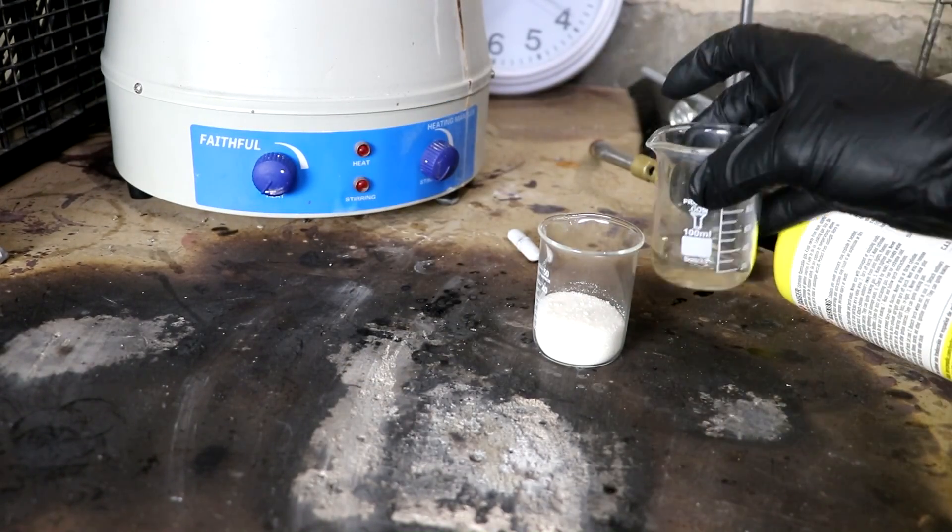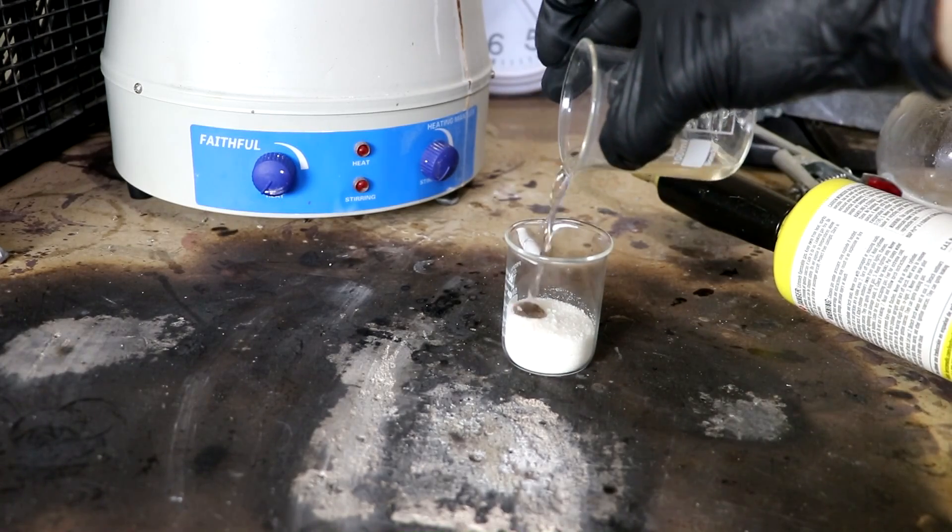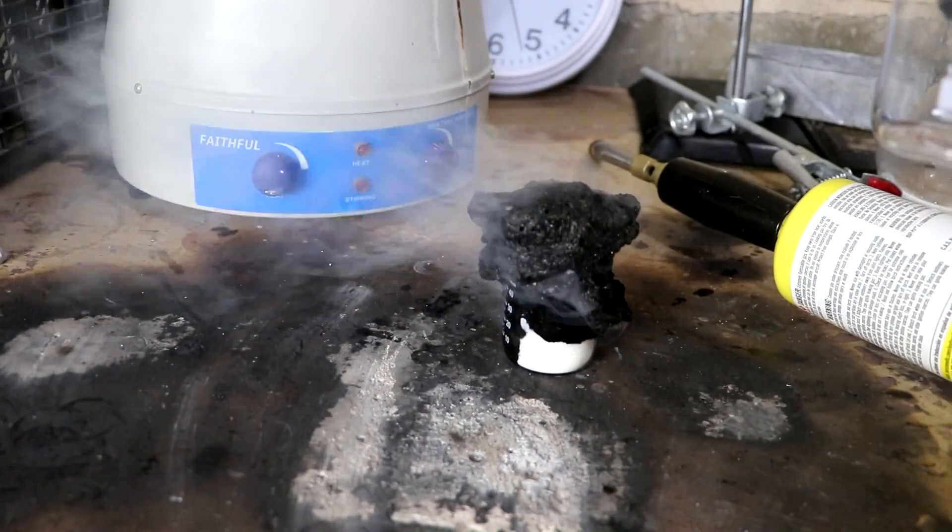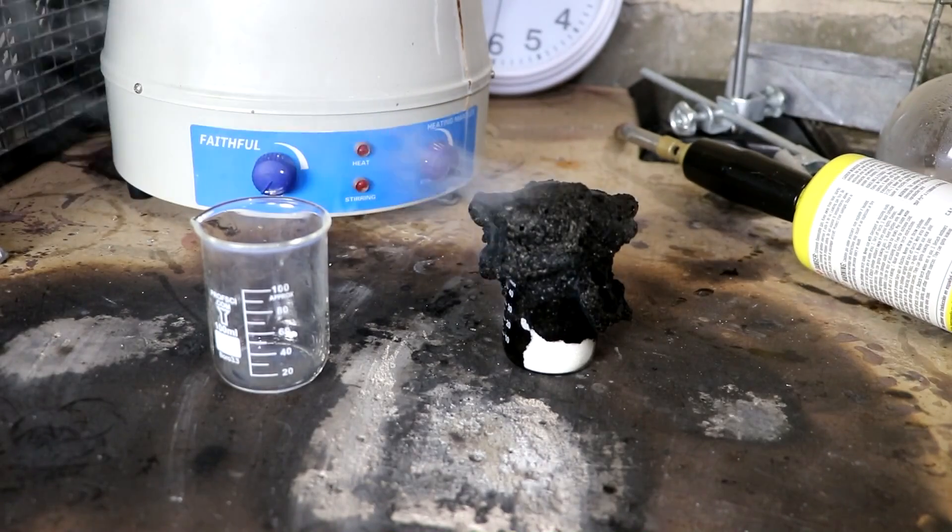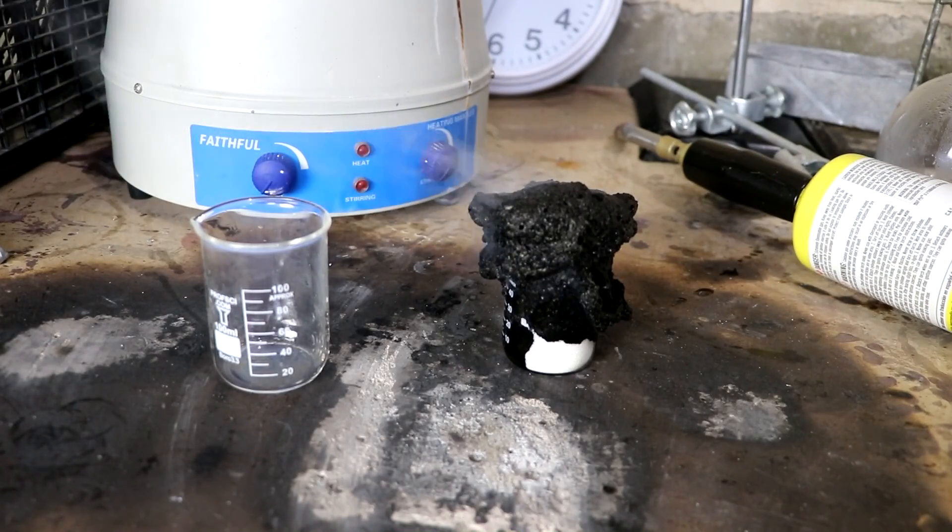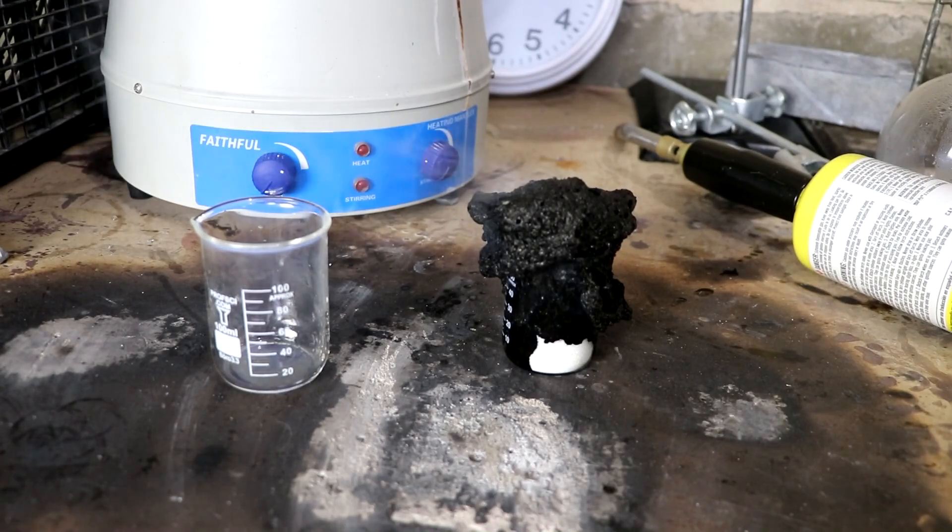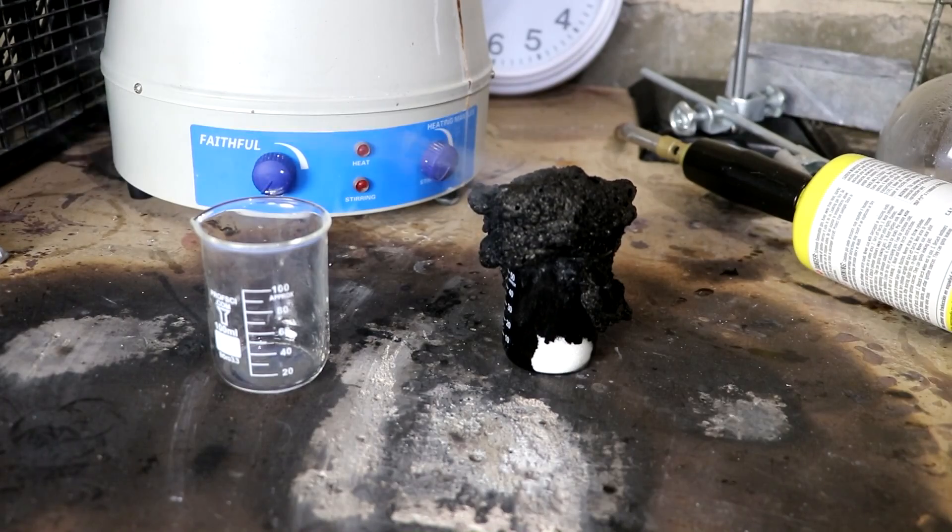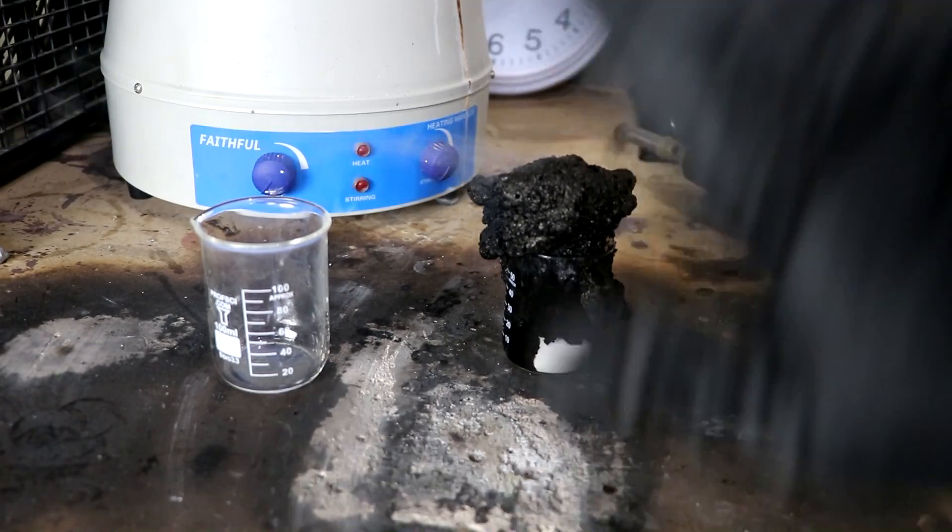Let's pour this into some sugar. See if it'll dehydrate it. I would say that's a dehydration. Neat. Didn't really... Oh, it's gonna do it.